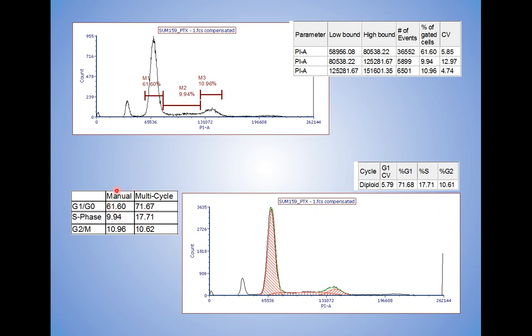Here's manual region analysis versus multi-cycle through the software, and you can see some marked differences in the G1, G0, and S. I have also seen differences in the G2M as well, but the differences here are remarkable. And if you're looking at a large number of samples looking for a subtle difference, you're not going to get there with this.